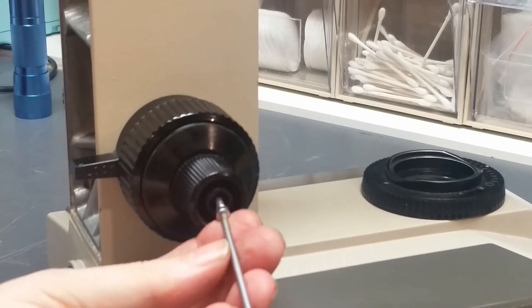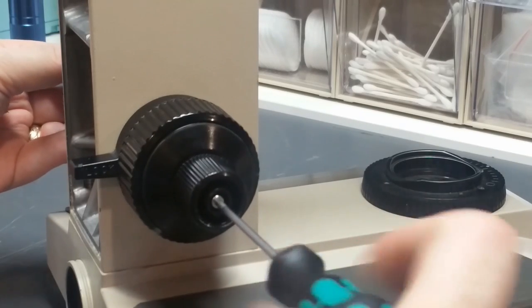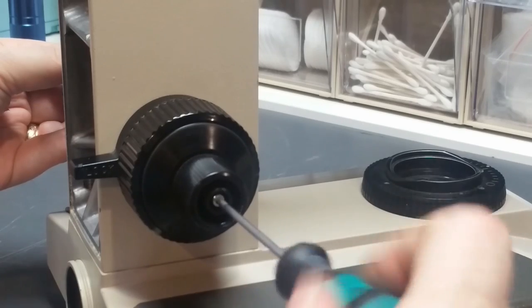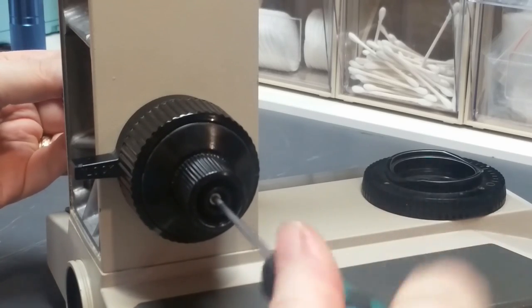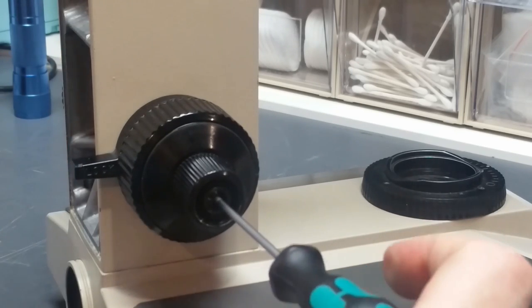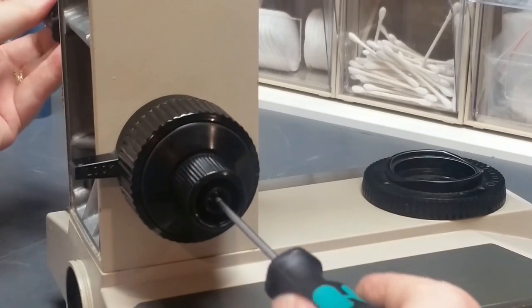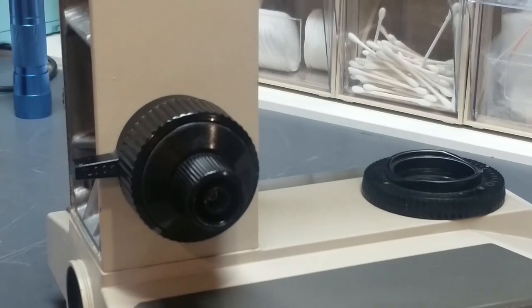So I'm going to put this in there. What I'm going to do is reach around the back, hold that knob. Use a 2.5 millimeter hex tool. Get that screw going. Run it down until it's basically hand tight. And now what I need to do, I need to take my second tool, put it in the other knob, and tighten these guys down.